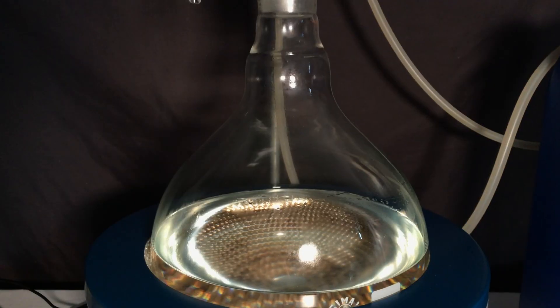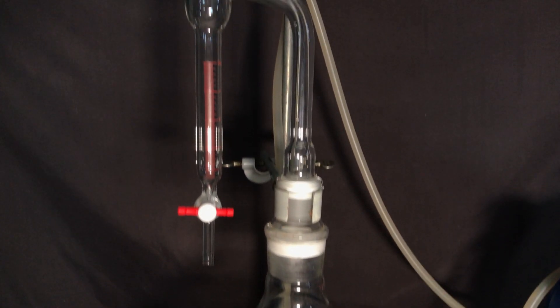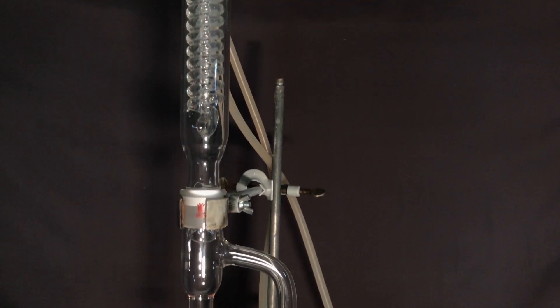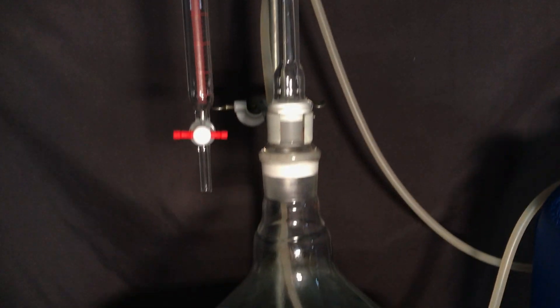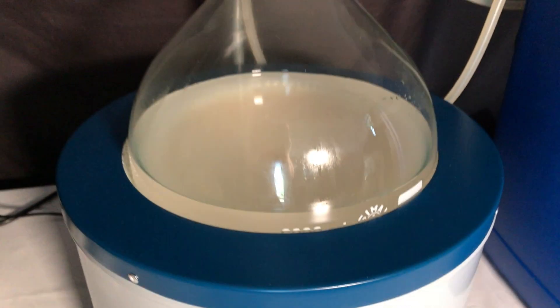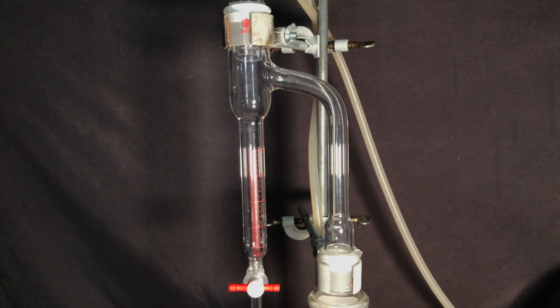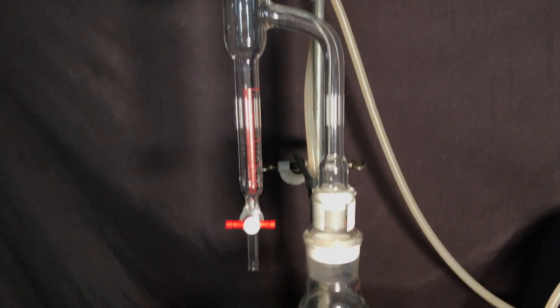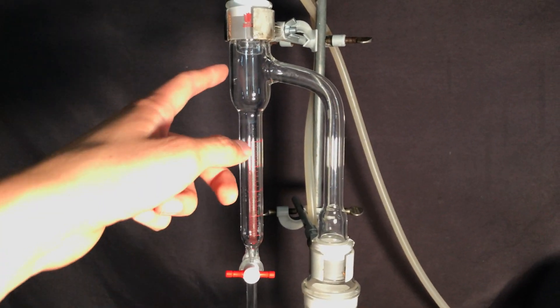The apparatus consists of course of our massive flask and heating mantle, a Dean-Stark trap and two condensers on top of the Dean-Stark trap. Stirring was turned on and you can see that the solution which was clear in the beginning quickly turned white. At room temperature the liquids don't dissolve in each other very well and therefore you saw this color change.